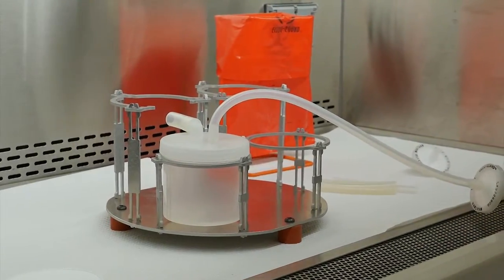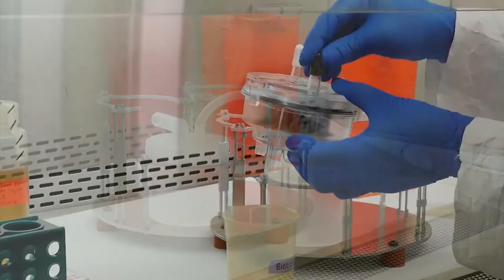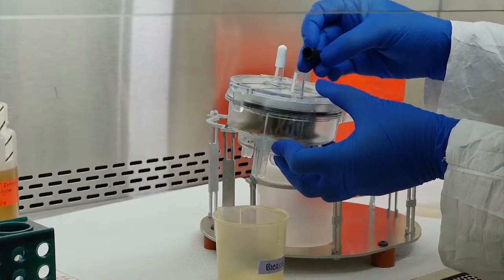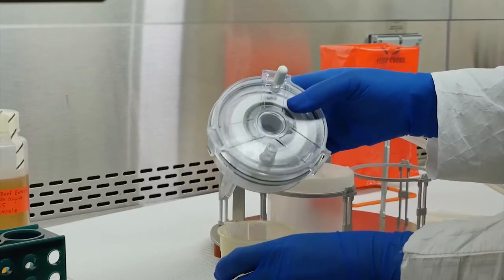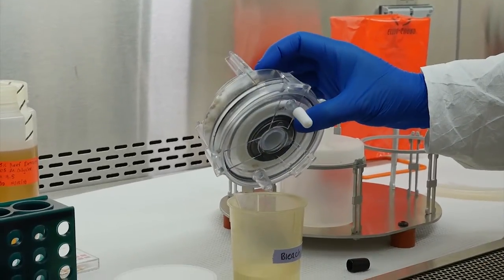You are now ready to bring your sample into the biosafety cabinet. If any liquid remains inside the ViroCap filter, remove the filter's black top inlet cap and empty the liquid into the small beaker filled with bleach.